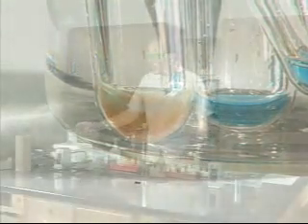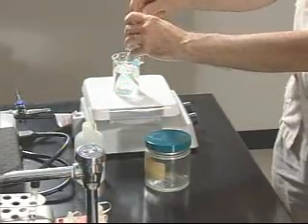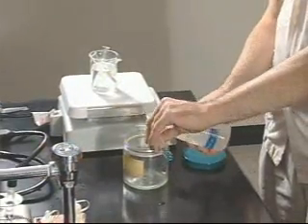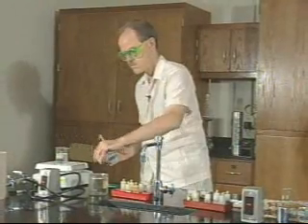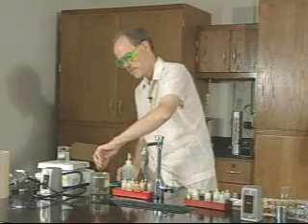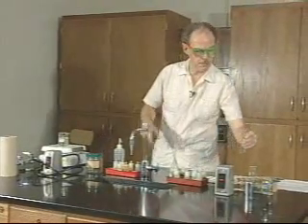When you're finished with Benedict's test, you need to record on your observation sheet the color changes that you see, and then you must get rid of the solutions by washing them into your waste container. Be sure to keep your waste container covered up so that the chemicals don't evaporate into the room.